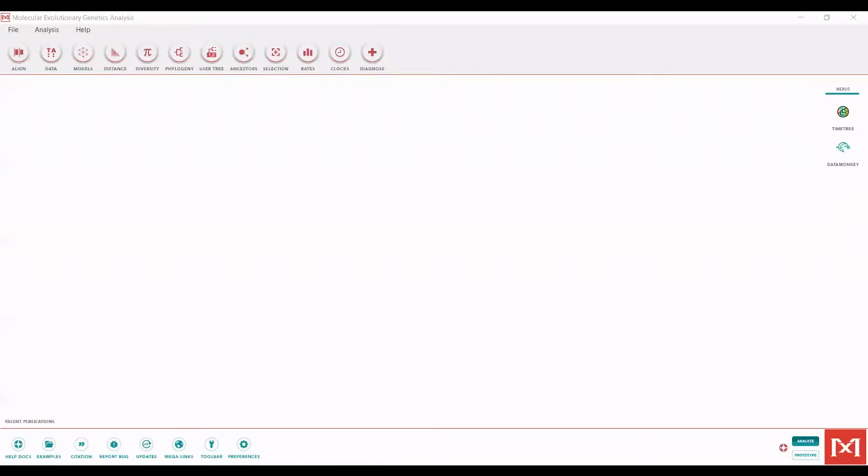Okay, so we have opened the next program that we're going to use. This is called Mega. So Mega is also a free software that you can download directly online. It is short for Molecular Evolutionary Genetics Analysis. And we are going to use this to actually align our sequences. And so this is the main page of Mega. It's a very nice graphical user interface. So there's a lot of tutorials online, and honestly, it's relatively intuitive to learn. But of course, I'll walk you through everything.